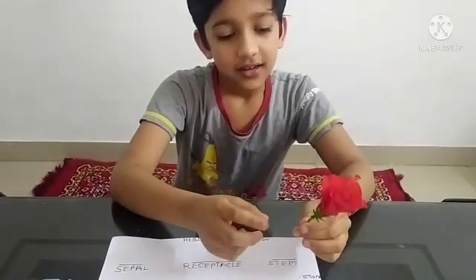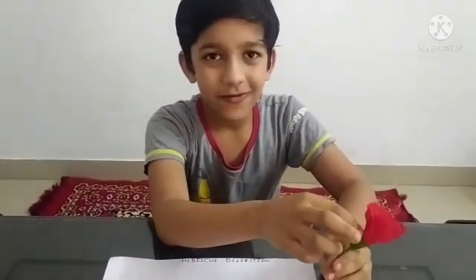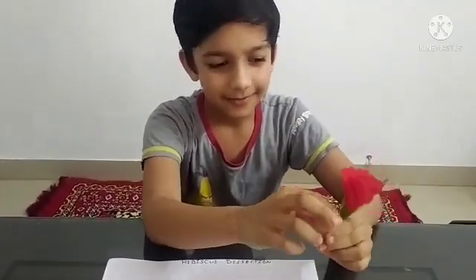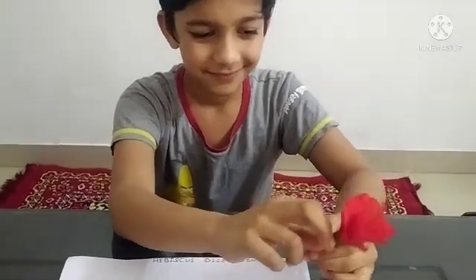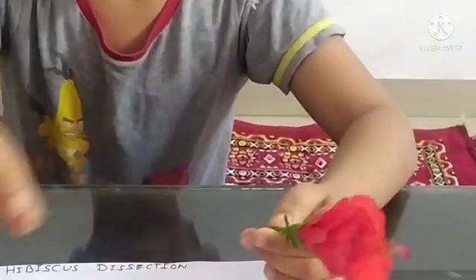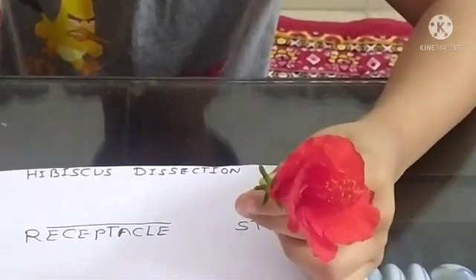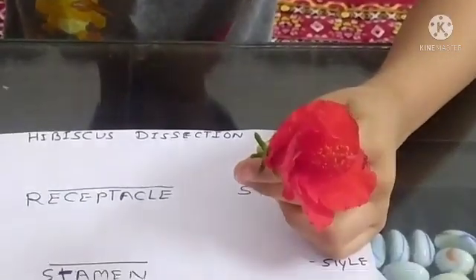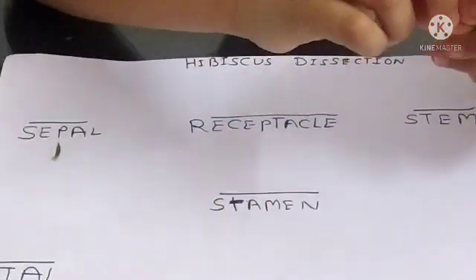First we will take out our sepals from here. Take out carefully because we don't want to damage our receptacles.